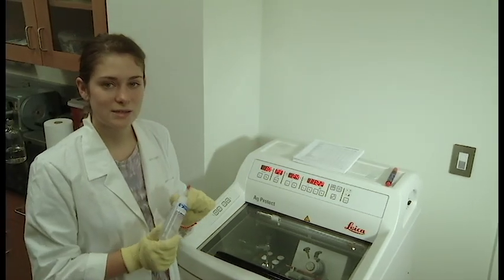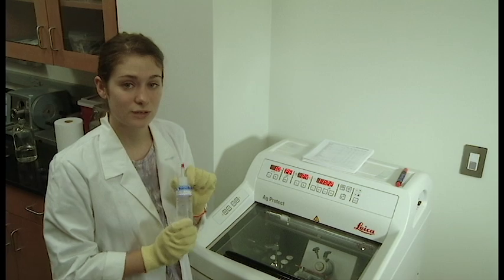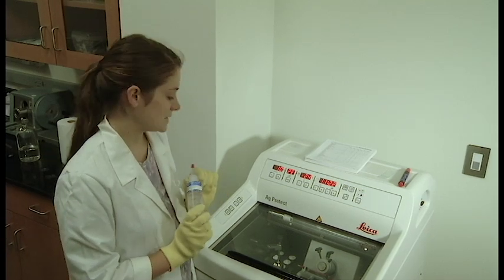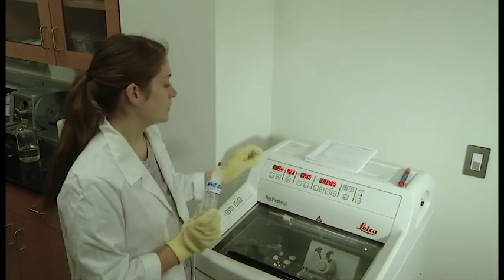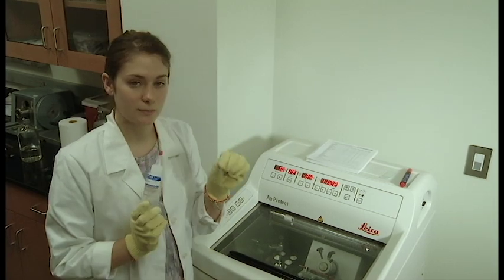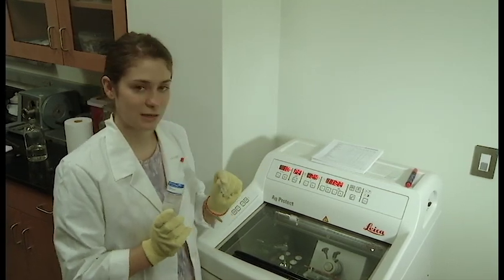We'll start by introducing some of the things that you're going to use. This is tissue freezing medium. You're going to place this around your tissues or in this mold when you're preparing them to go on the block to be cut.